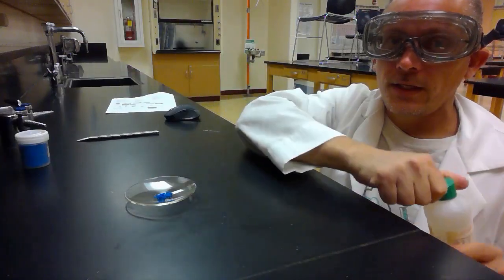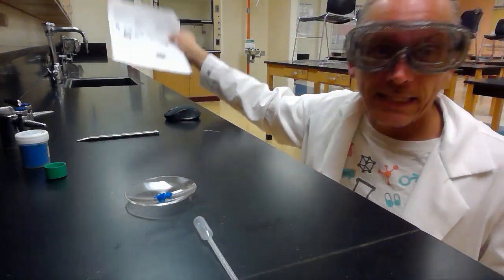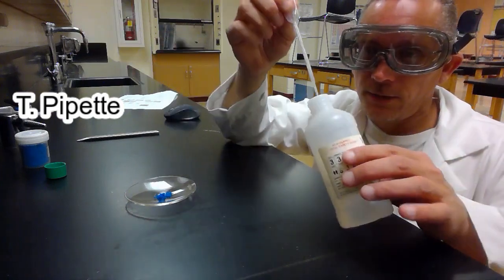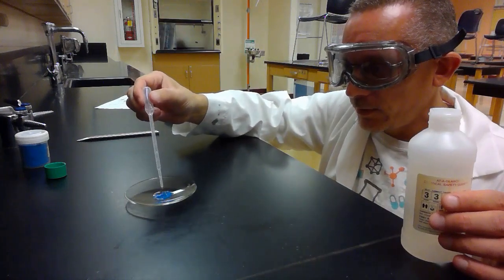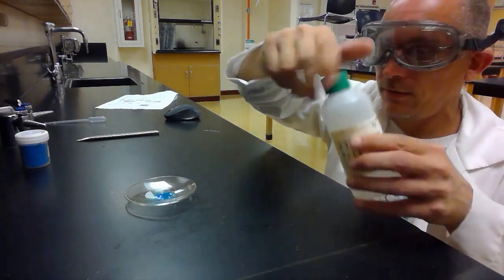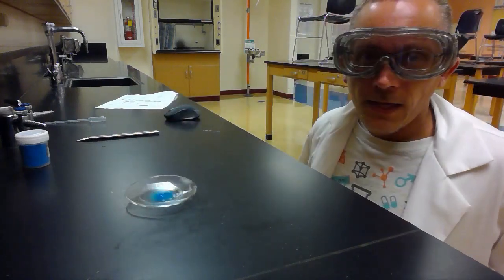So here I have some alcohol, and I have another one of the pictures here. This is what's called a pipette. Picture T. Picture T is called a pipette. This particular one is called a disposable pipette because it's cheap plastic and we can throw it away when we're done. So I'm going to take my pipette. And what's a pipette used for? It's used for moving a liquid. So I'm going to put some of that in there. I'm going to put my alcohol at a safe distance. And then I'll have a little fun here. There we go. All right.